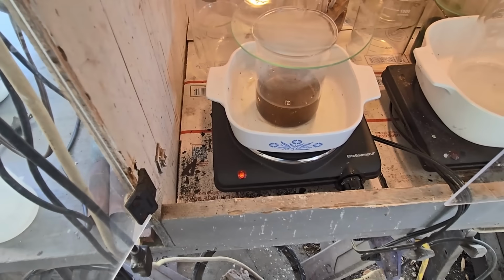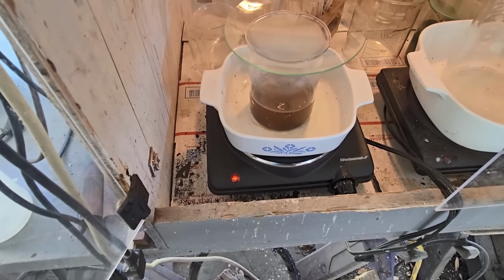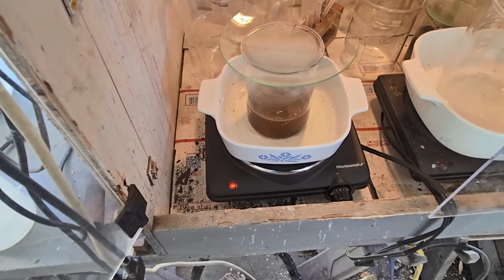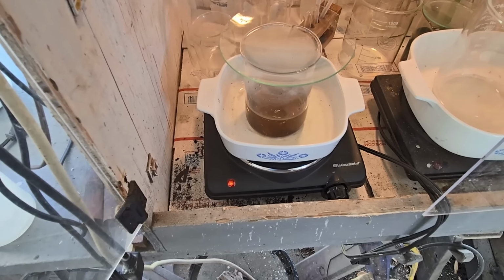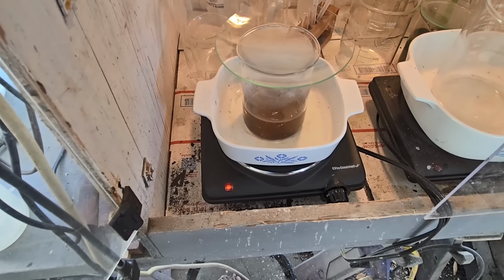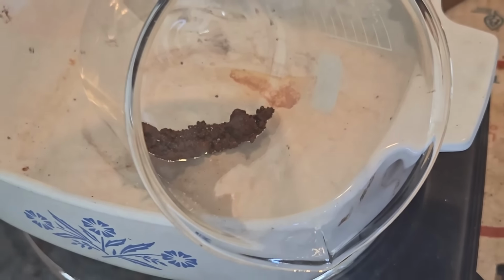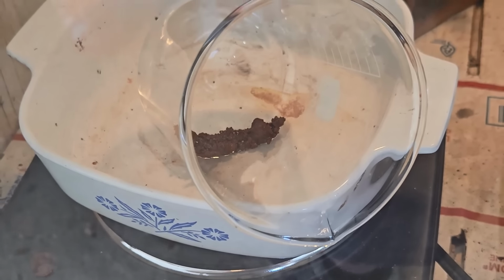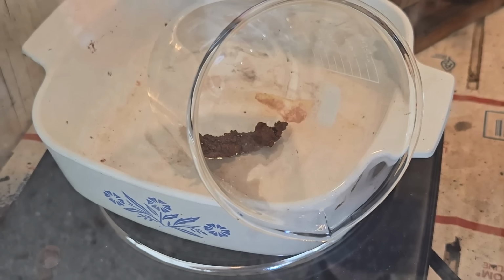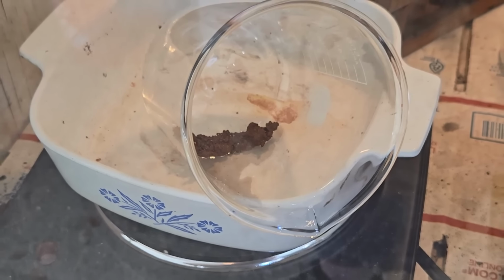We won't lose that. That filter will go in Johnny's filter and rag bucket for later recovery. And then once I've given it 3 boils, we're going to dry it out and weigh the powder and see how much gold we recovered this time around with the iodine leach. Alright, the gold has had its 3 boils in distilled water. We're going to dry it out slowly on low heat. And once it's good and dry, we'll weigh it up and see what we got.